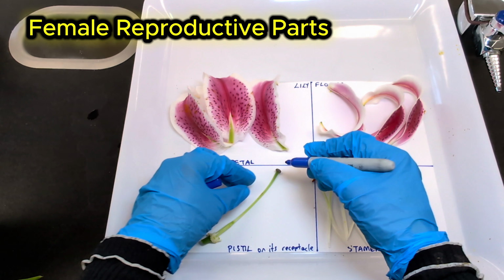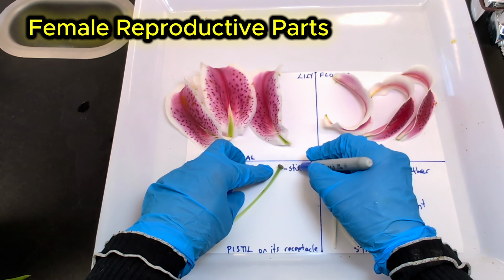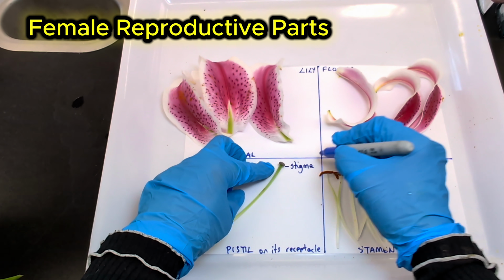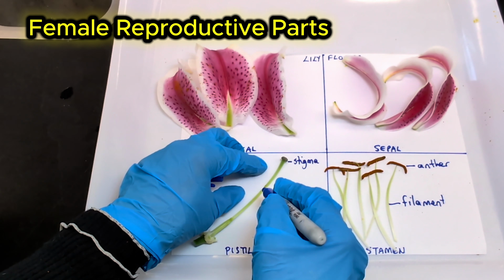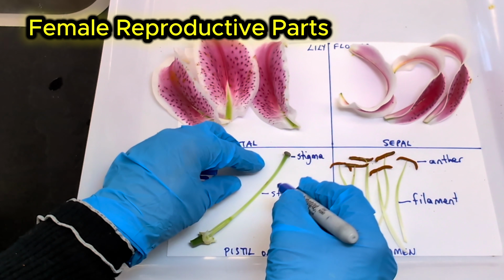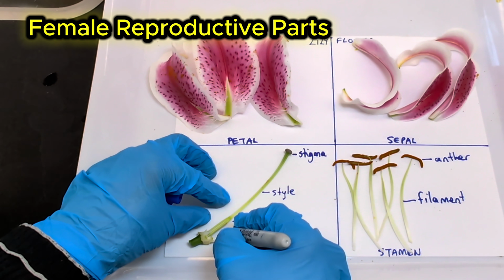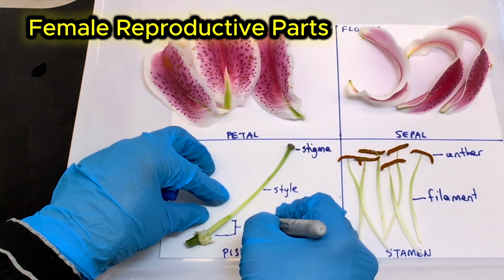As you can see, the pistil usually stands taller than the stamens. It has 3 main parts. The stigma at the top is often sticky to catch pollen. The style is the tube-like structure. And the ovary is found at the base. This is the part that contains the ovules.